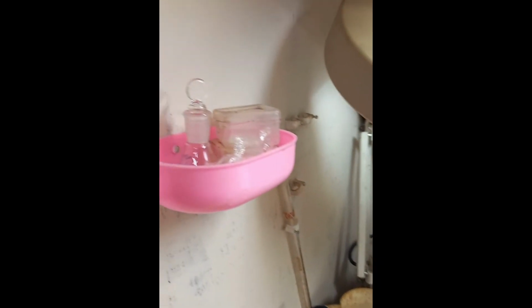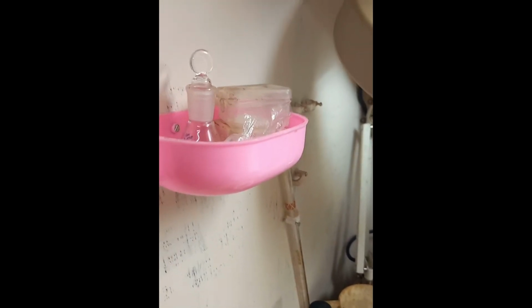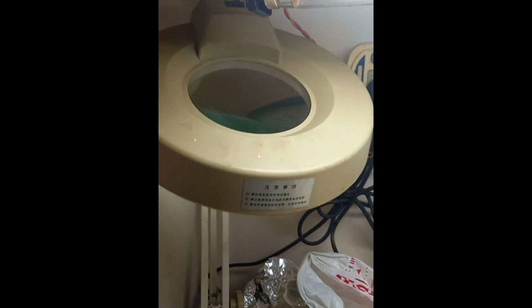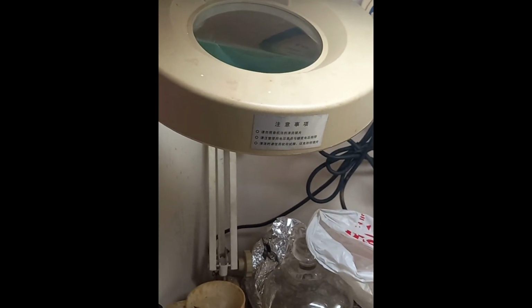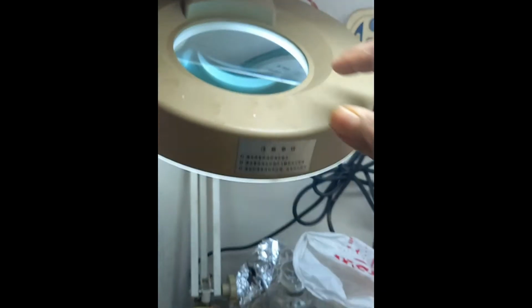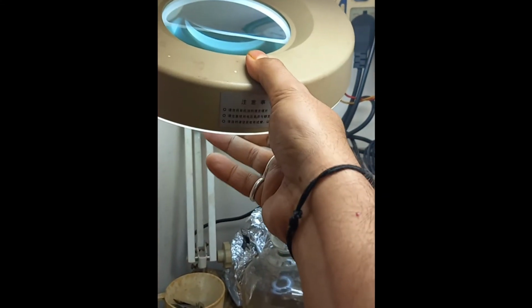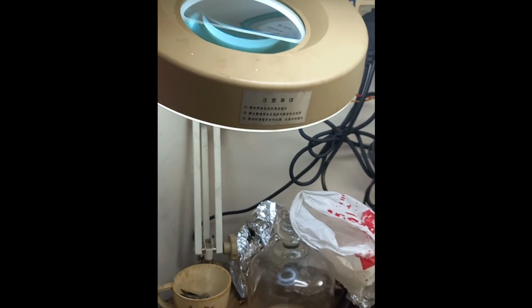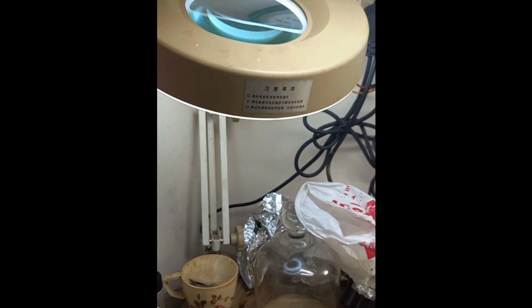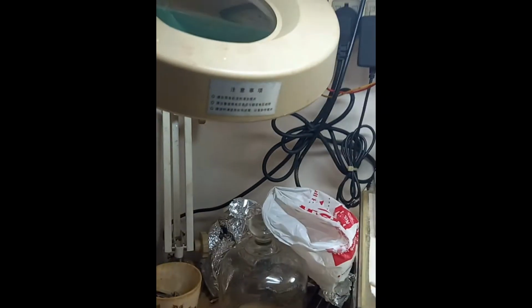These are some small flasks needed for mycotoxin extraction, and this is a magnifying glass. This is necessary for macro investigation. It is just a magnifying glass. You can switch on the light and draw it like that, and you can watch something from there, and that will be a good low magnification.